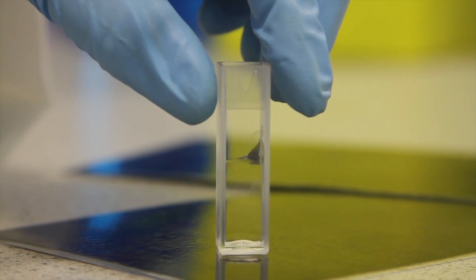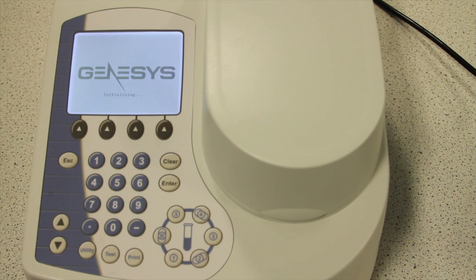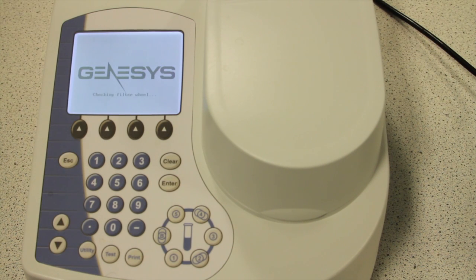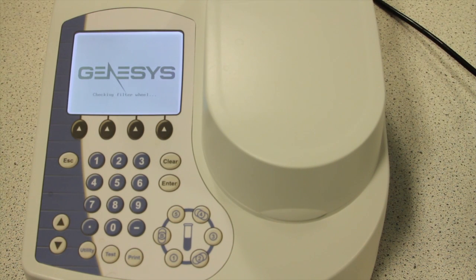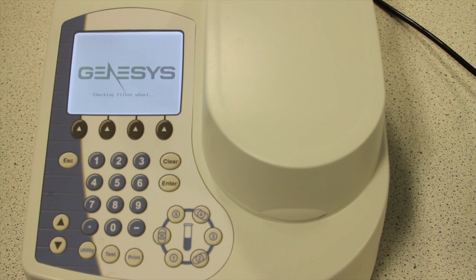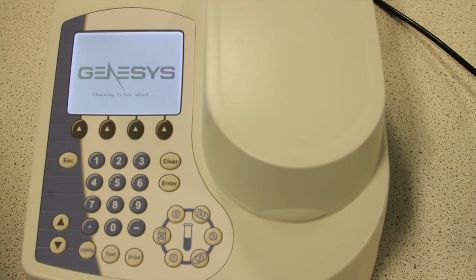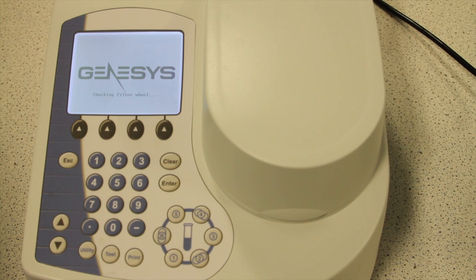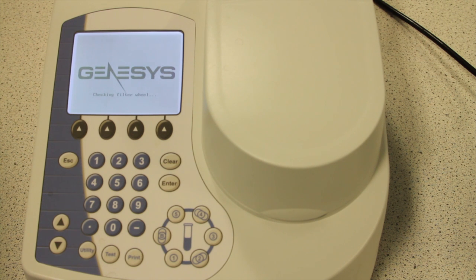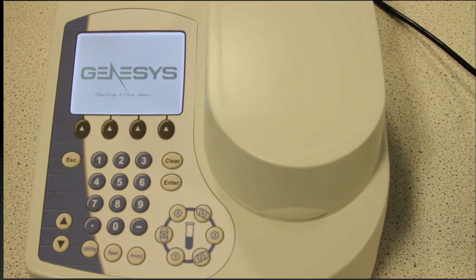Around three millilitres of the solution is added to the cuvette. We now need to set up the spectrophotometer. It will take a few minutes for the machine to calibrate itself ready for use. Ensure that the lid is closed and while you wait, set up the samples.